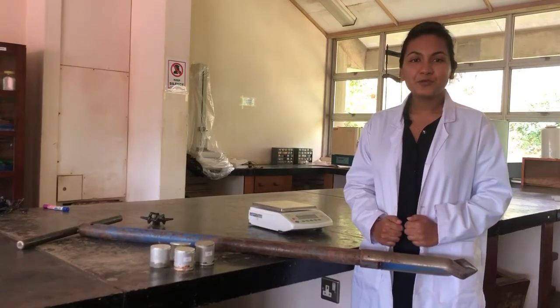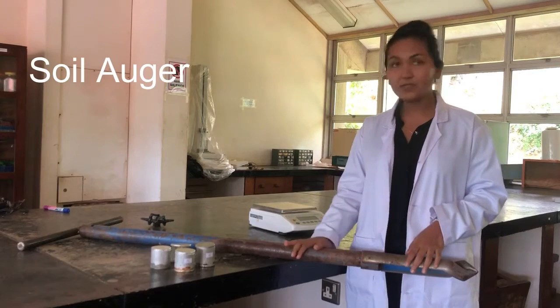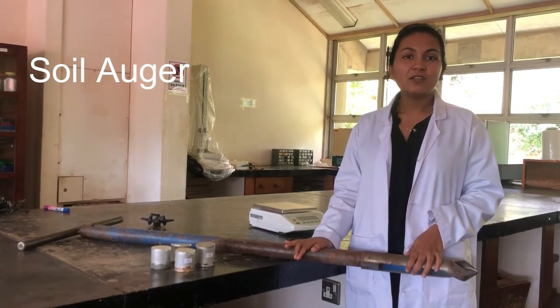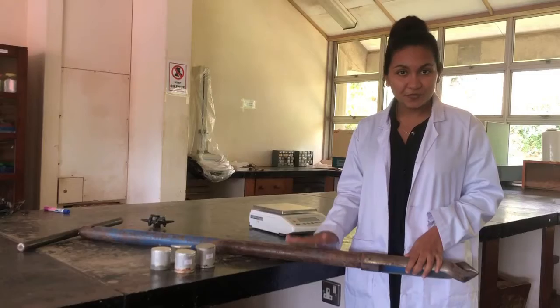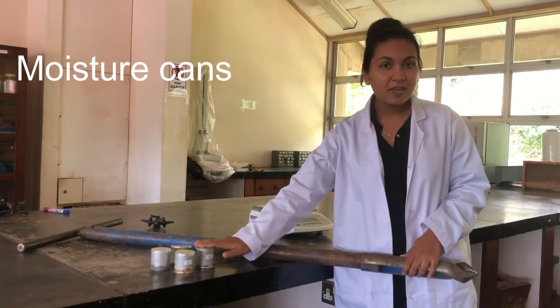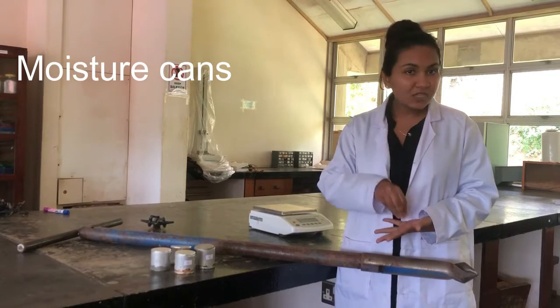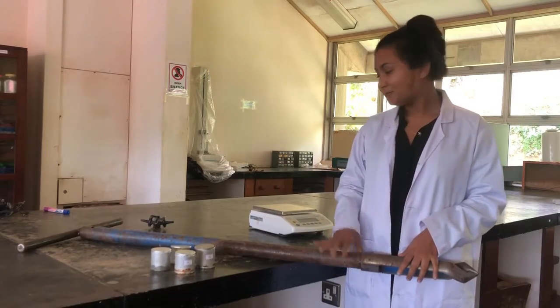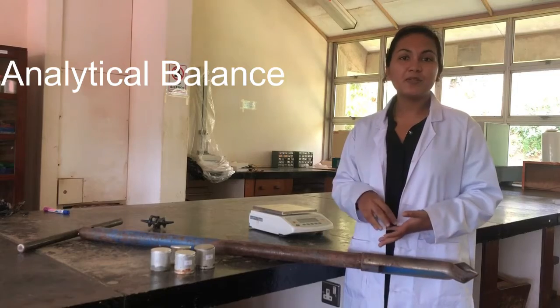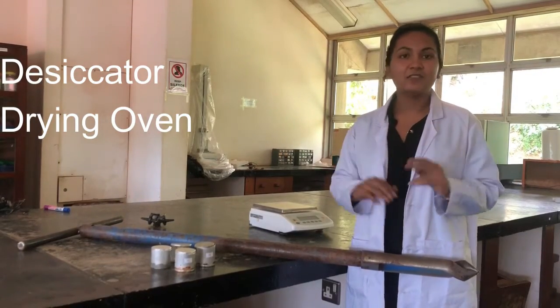Now we are going to introduce the materials and instruments we need. This is the soil auger — we use it to collect soil samples from the field — and the moisture cans, in which we keep the samples. We also need a balance to weigh the soil samples, a desiccator, and an oven.